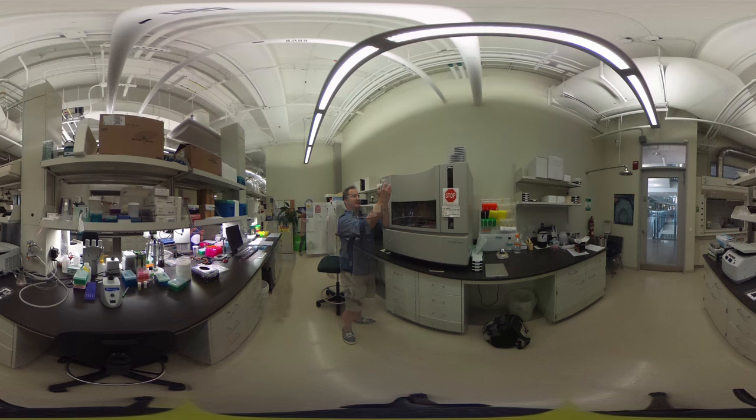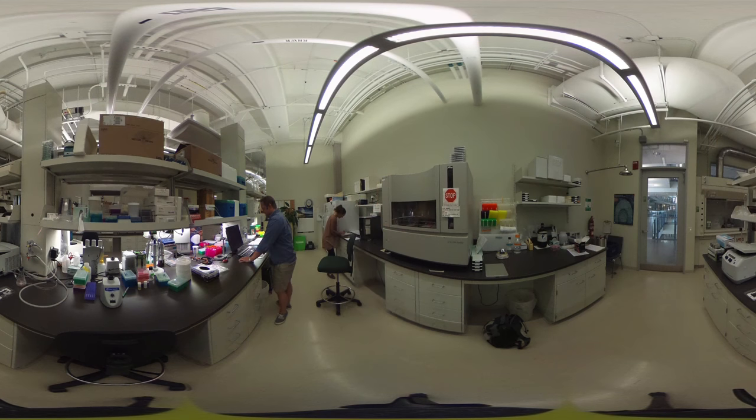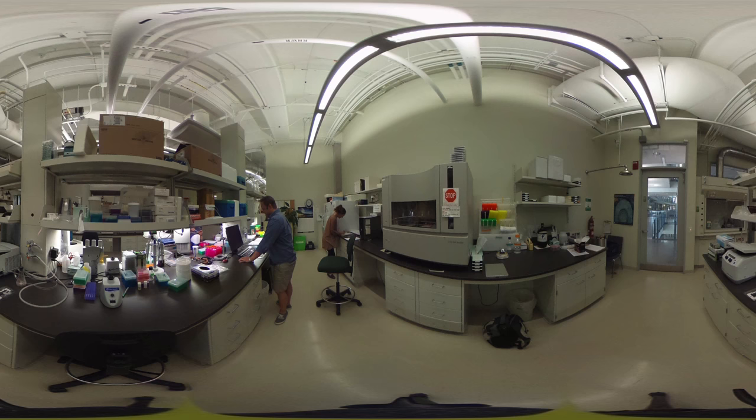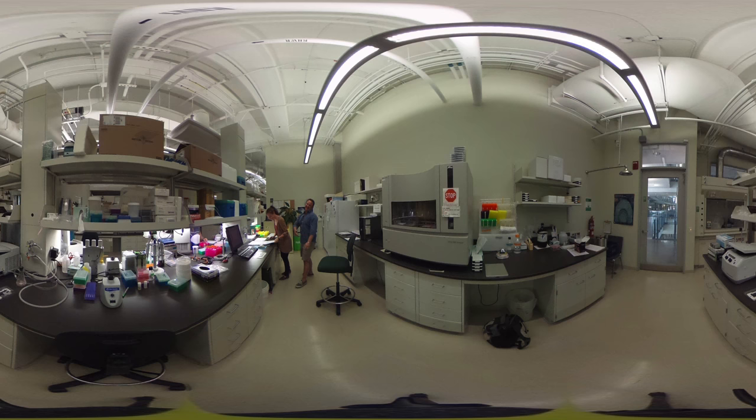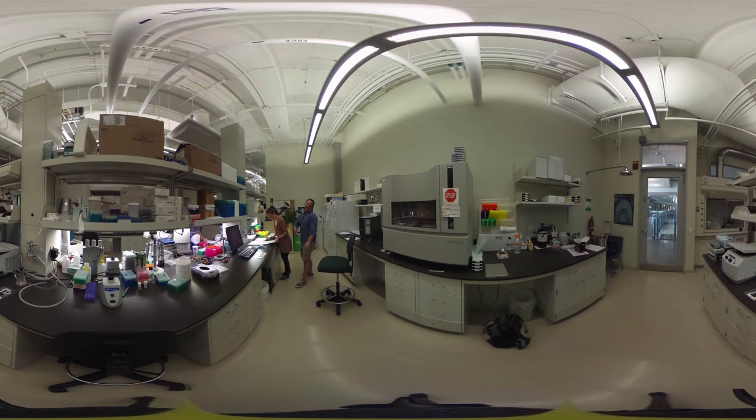With next-generation sequencing we're dealing with millions of reads, but those reads may not all be necessarily correct because they're happening so quickly. With the Sanger sequencer, we're only looking at 96 samples at a time, and instead of millions of reads we're dealing with reads up to 750 bases — but they are extremely accurate.